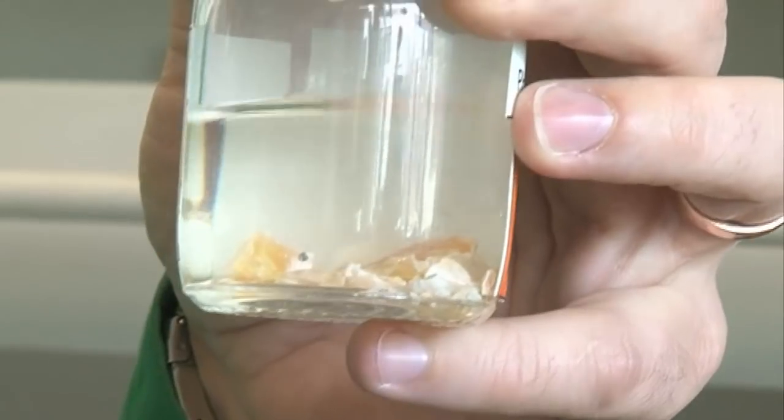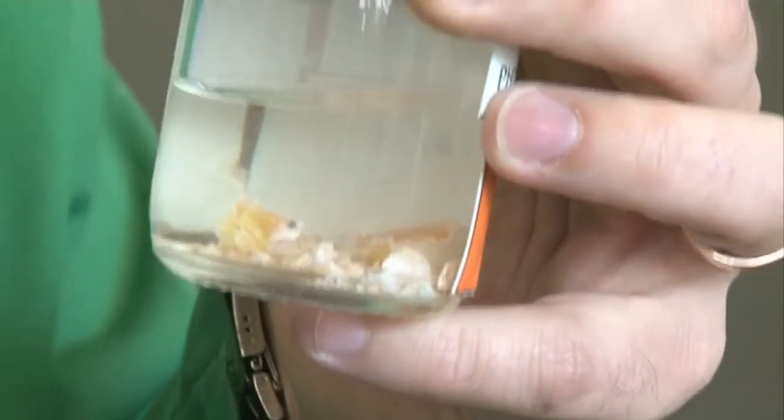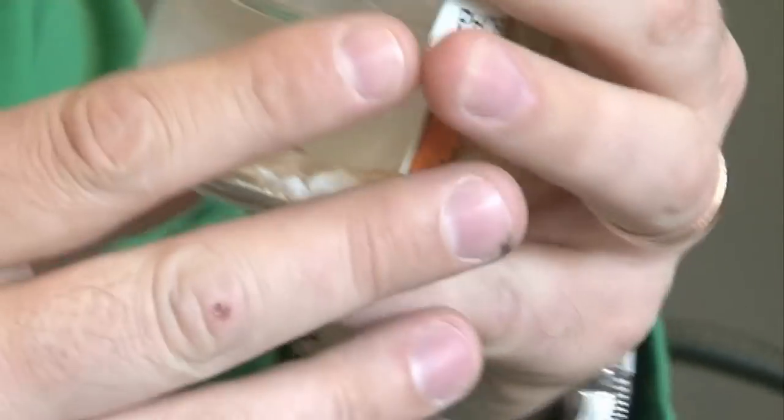And you'll notice it's stored under water because it's really, really reactive. If I take it out and I let it warm up, give it some activation energy, it'll start to react with the oxygen in the air around us.